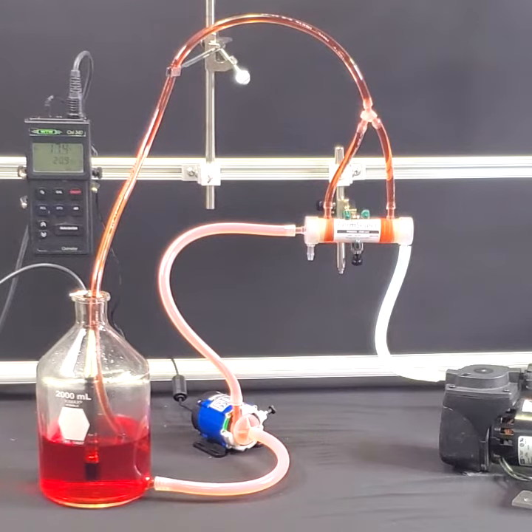With water flowing at about 2.5 liters per minute and air flowing through the gas exchanger, we see the DO in the bottle begin to increase.